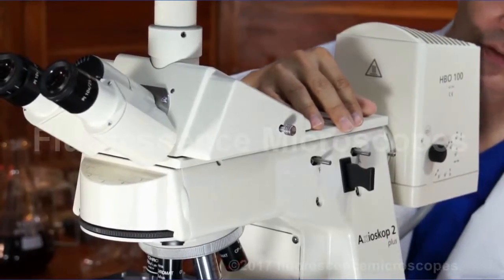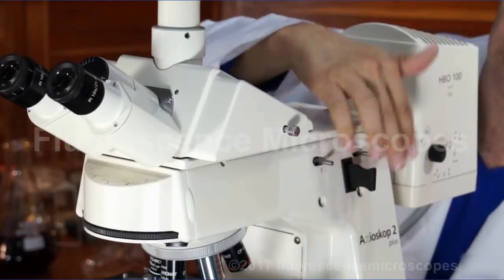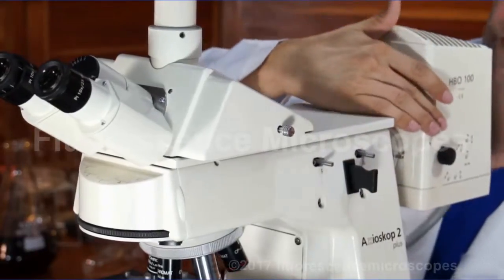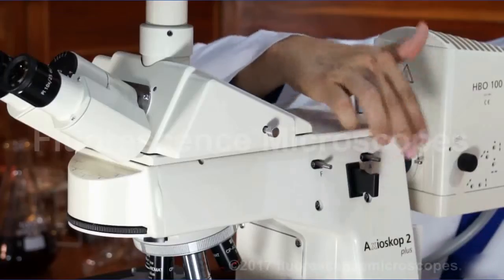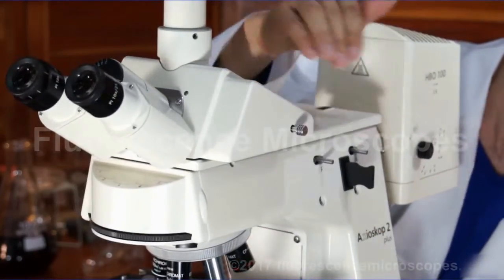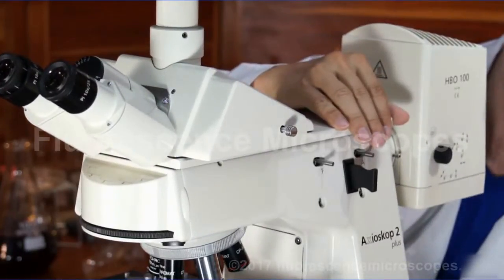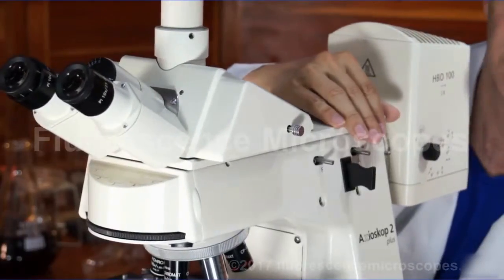And it has a filter slider. It also acts as a shutter. You push this all the way in and it blocks 100% of the light. You want to always block your light when you're not looking at it, because otherwise you're going to be photobleaching your specimen, your filter cubes, as well as photo-toxicity on your cells.